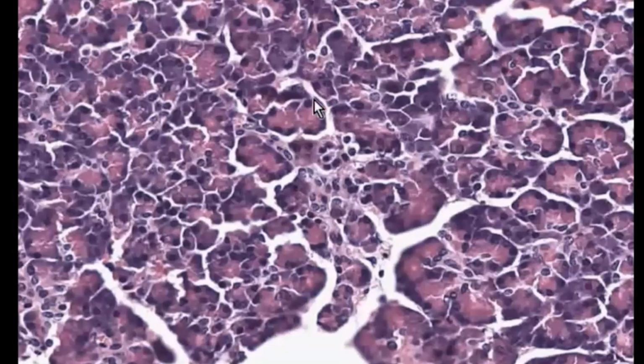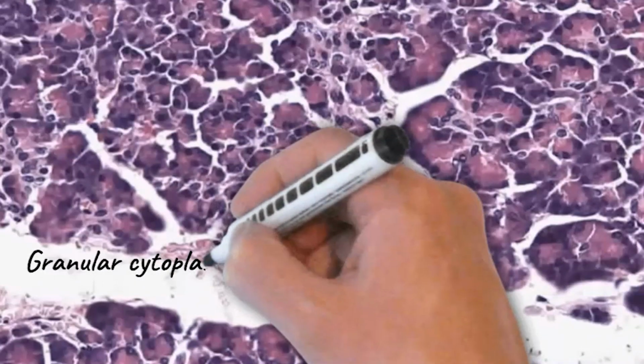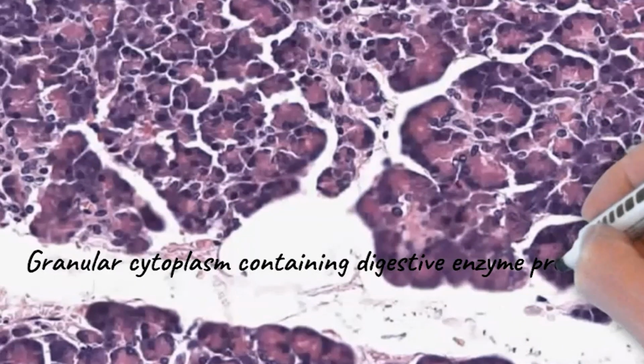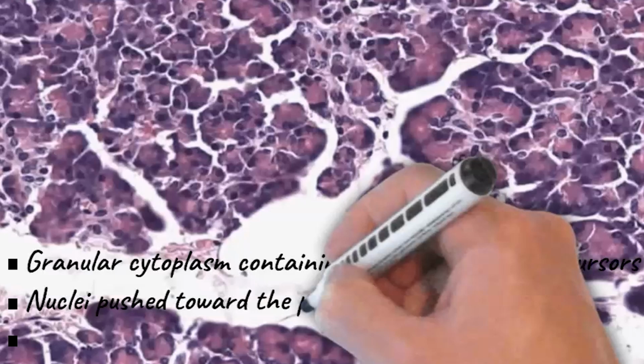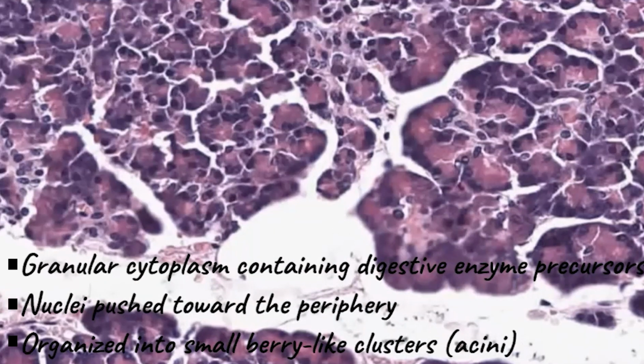Let's talk about the exocrine acini and the zymogen granules. The bulk of the pancreas consists of exocrine acini. An acinus is a small cluster of 5 to 10 serous cells packed with zymogen granules, which stain dark and fill the apical cytoplasm. Features of the acinar cells are granular cytoplasm containing digestive precursors, which are enzyme precursors. Nuclei are pushed down towards the periphery, and they are organized into small berry-like clusters, the acini.